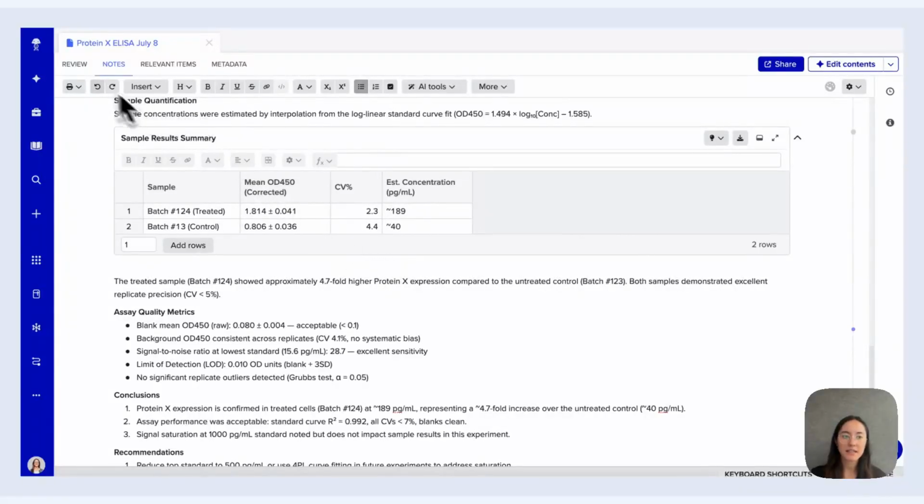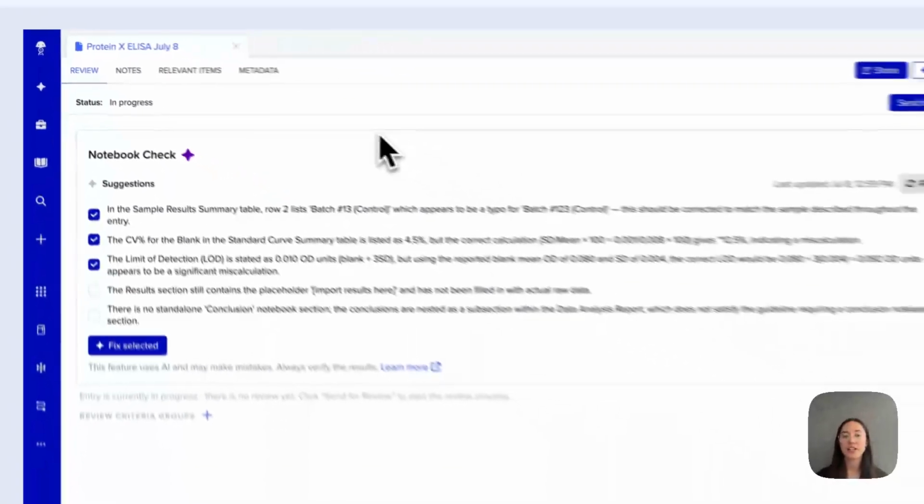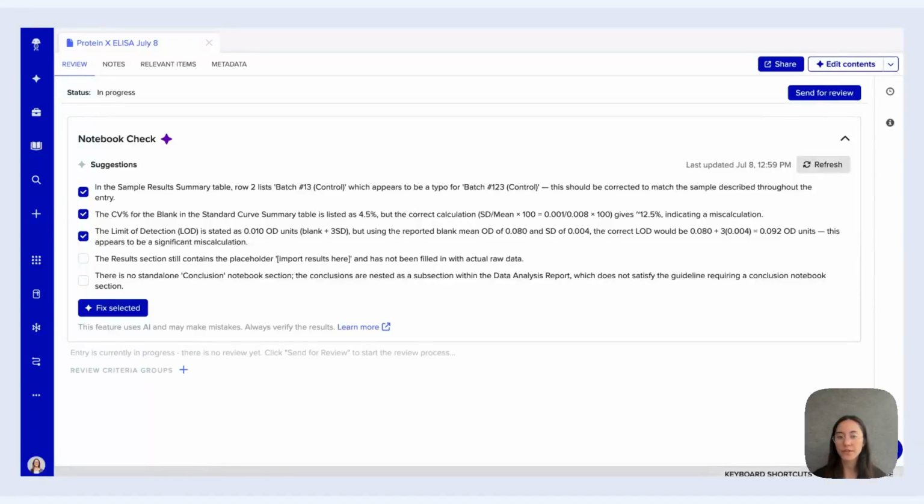With Notebook Check that is accessible through the Review tab, you can have AI-generated suggestions available for you, so you can use this to catch mistakes, typos, missing sections, and other things that you might want to customize for your tenant using the Tenant Admin Console's configurations for Notebook Check.